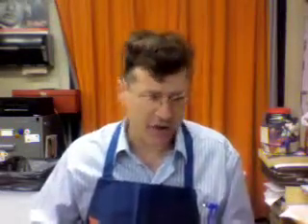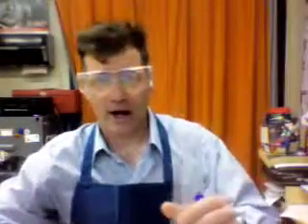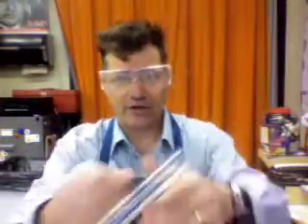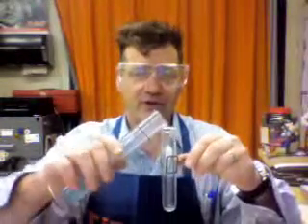So let's get started. First of all, this is a relatively dangerous lab, because it involves heat, fire of course, and so we want to make sure we wear our goggles. And I have an unknown blue liquid, and I'm going to pour about 30 milliliters into a graduated cylinder. In this case, I'm going to use a test tube holder. You guys will probably be using ring stands.